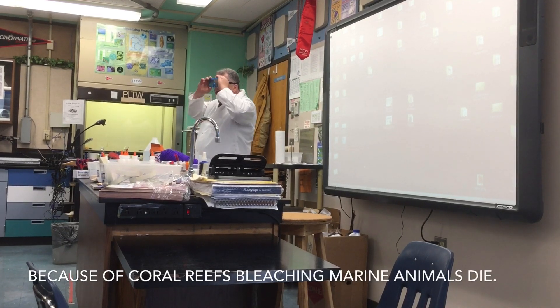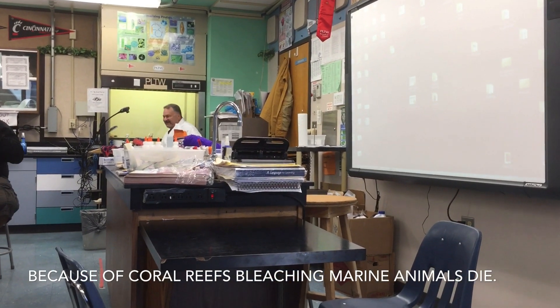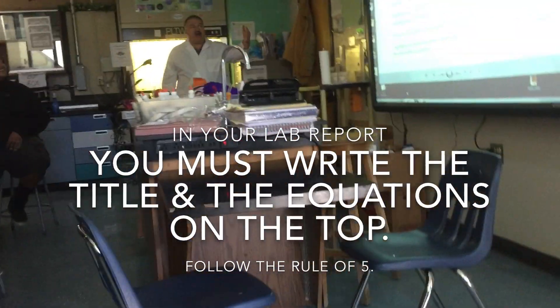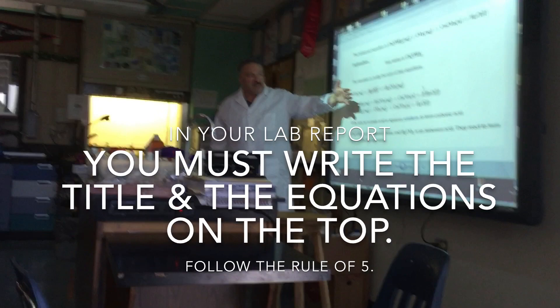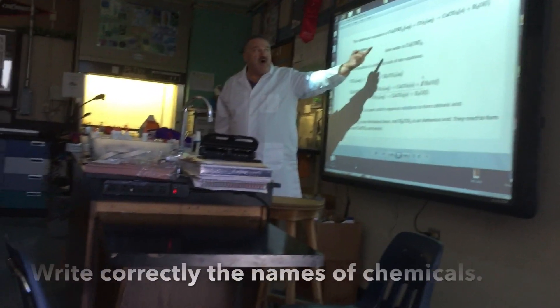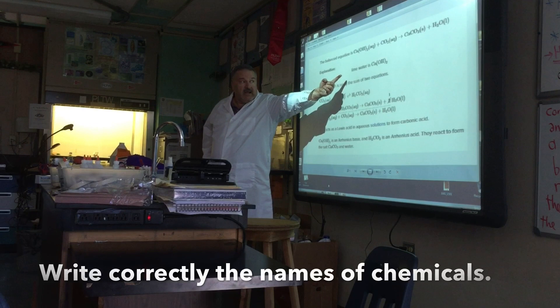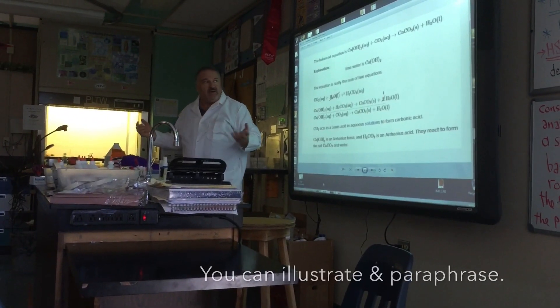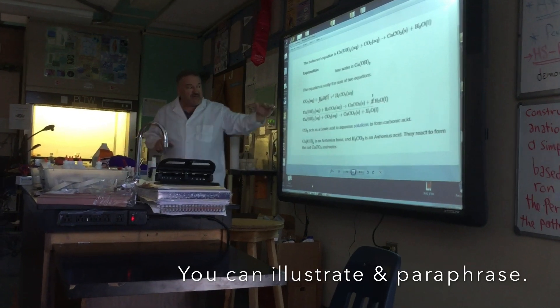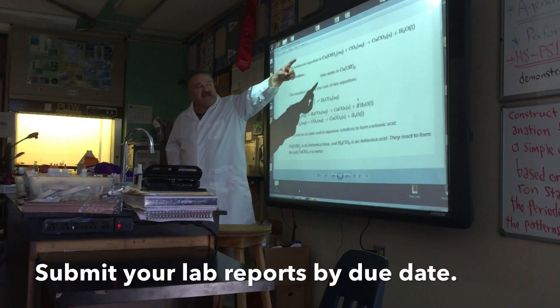Here is the equation. I'm going to explain the whole reaction for you. Let's turn off the light. Here is the chemical reaction — you're going to write the two equations that make up the whole chemical reaction. This is calcium hydroxide, the lime water. I put carbon dioxide in it — the air from my mouth — into lime water, and it forms a precipitate called calcium carbonate, which is a salt, and water. That whole thing you saw today is a chemical reaction. Here is the first equation, this is the second one, and if you add them together, here is the final one.